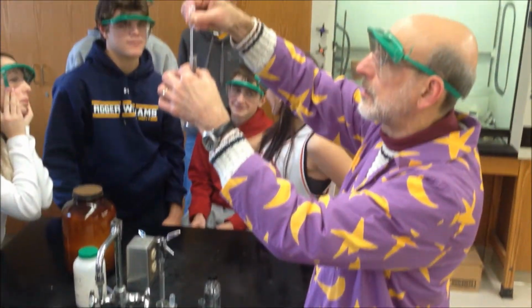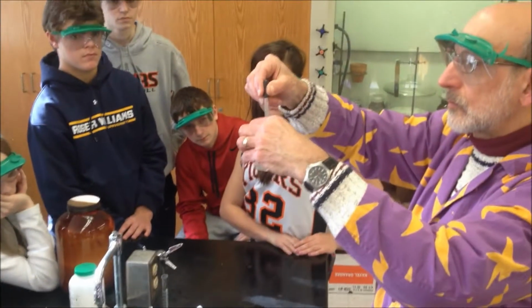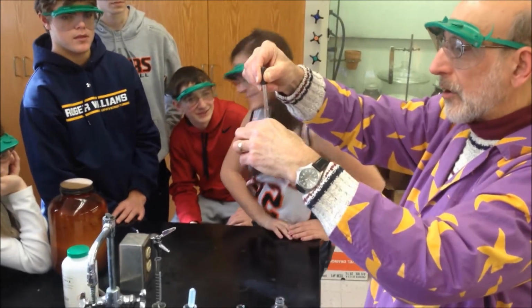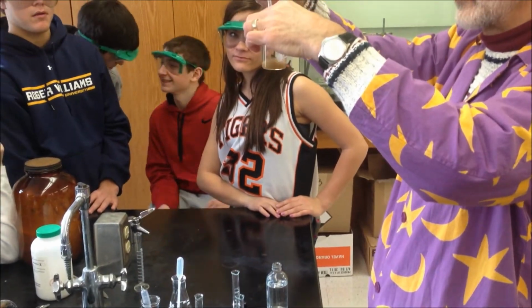Little jars. And then I'm going to do a couple more things, and then I'll explain what you three guys have to do. Okay, so first you get that sort of brown stuff, and then it goes away. It's nice and brown. Good color.